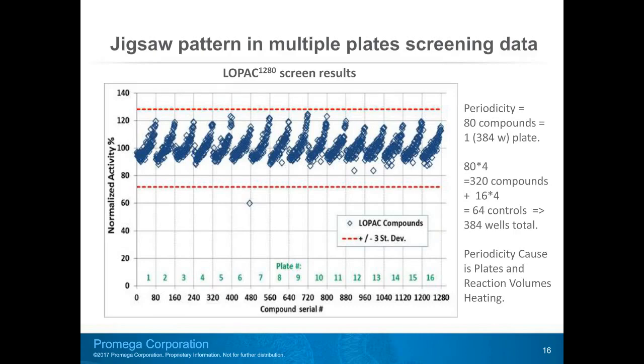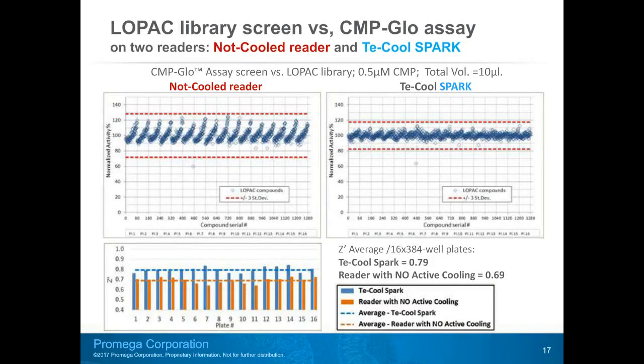Plate numbers are in the green ink at the bottom of the graph. After screening quadruplicates, results for each compound are averaged, and each average value is represented by a single data point on the graph above. And if you look at the results from the screens, you see a jigsaw pattern or periodicity for each plate, or every 80 data points.